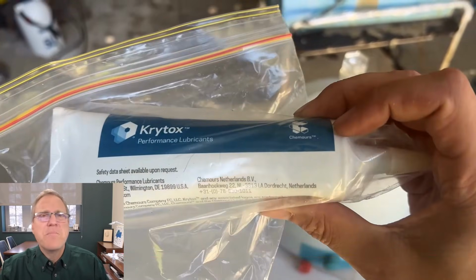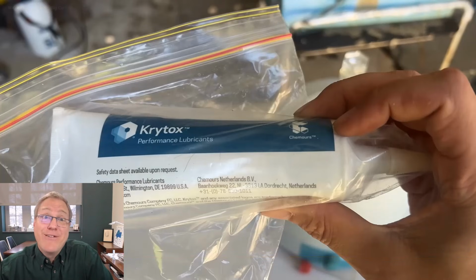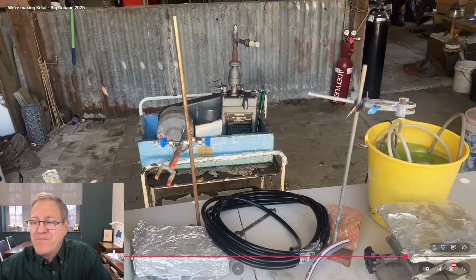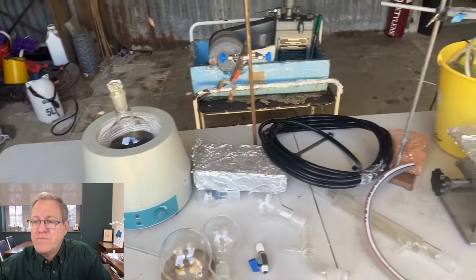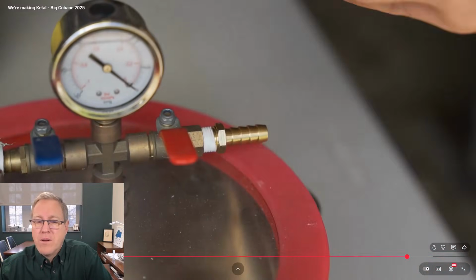That is true. That is a massive amount of grease, but for some reason when you get grease in labs, vacuum grease, they always give you these big tubes. You will never in a lifetime use that much grease, but they give you these massive tubes. It's cheap stuff, but it is a big tube. Yeah. Hopefully the vacuum pump goes okay. Yeah, let's just try and run this vacuum distillation.